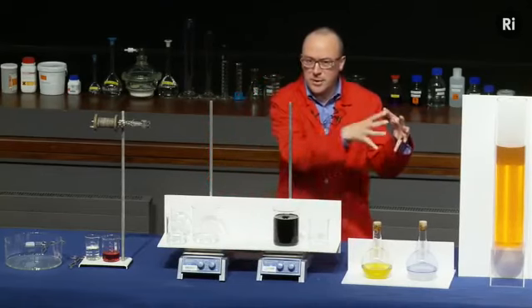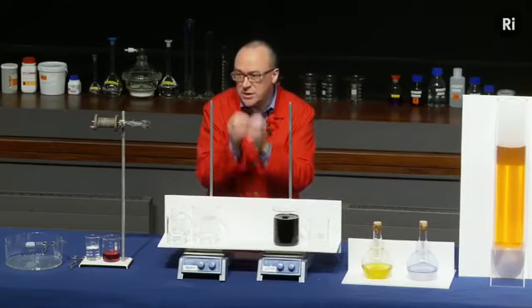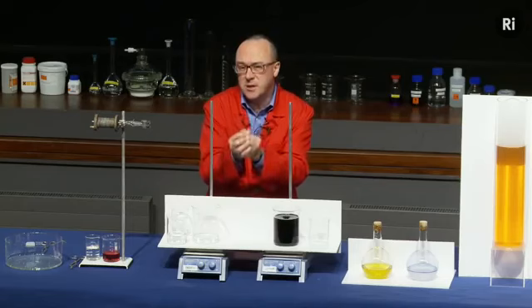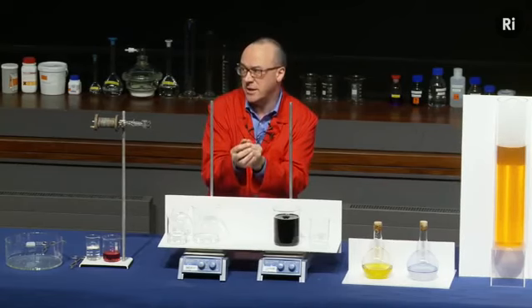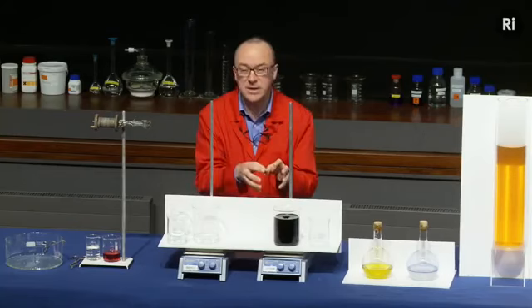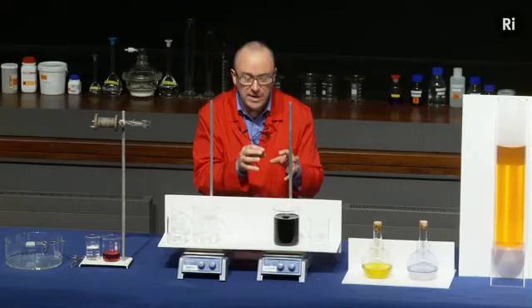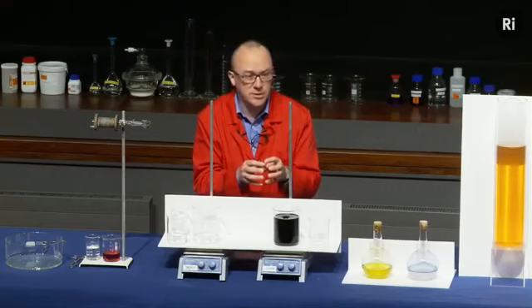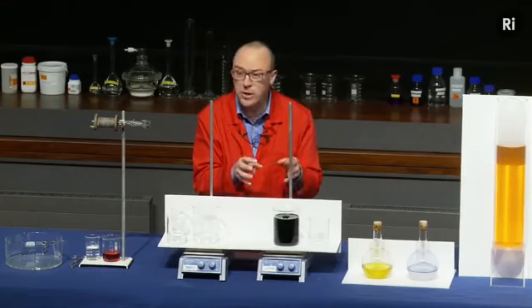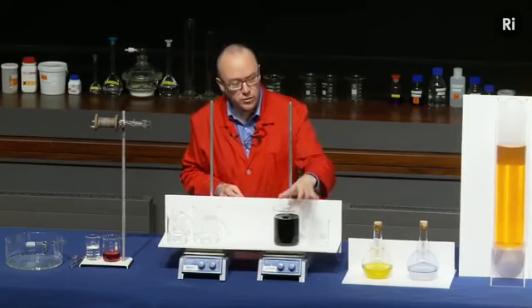So the iodine is being produced slowly, it's being mopped up by this second material as soon as it's produced, but when that second material runs out after about 10 seconds or so, the next little piece of iodine to be produced remains in solution. And because the iodine's a bit hard to see from the back of the room, we've added some starch. The iodine reacts with the starch and produces a very dark blue colour that appears to be almost black. Okay, so that's called a clock reaction.